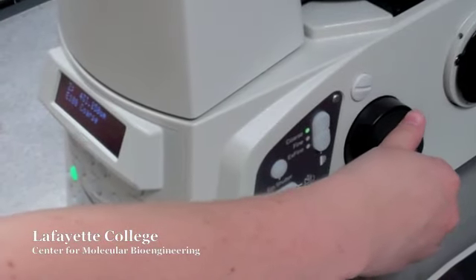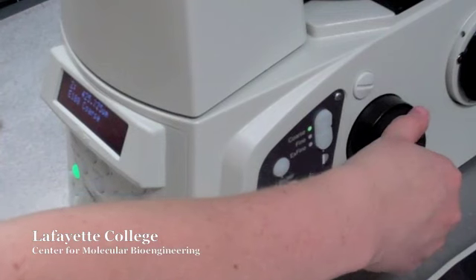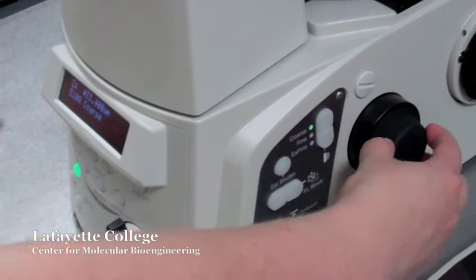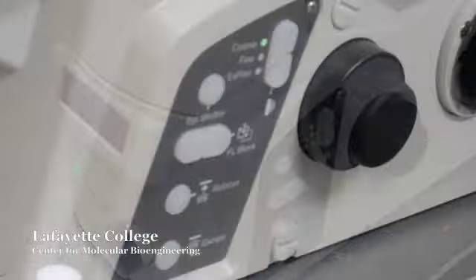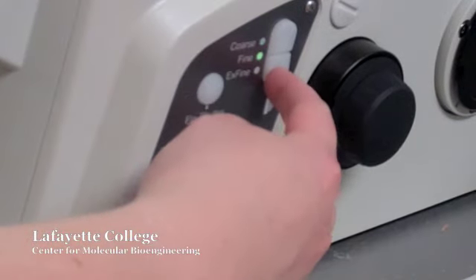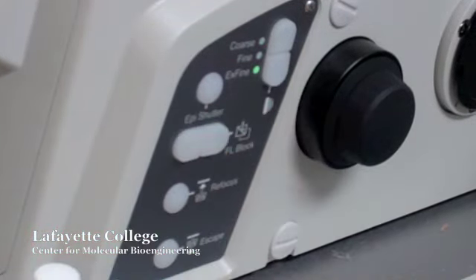Look through the eyepiece while adjusting the large knobs on either side of the confocal to focus the image in the Z direction. As the display will show you, rotating the knob towards you will raise the nosepiece, while rotating the knob away will lower the nosepiece. Switch between coarse, fine, and extra fine focusing using the buttons on the right or left sides of the microscope.